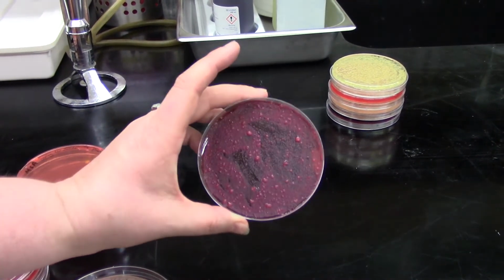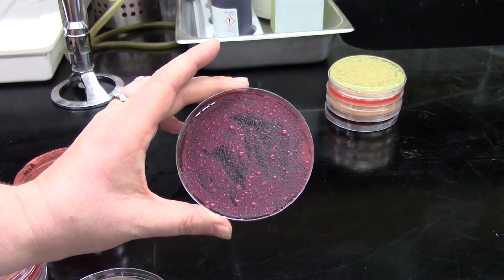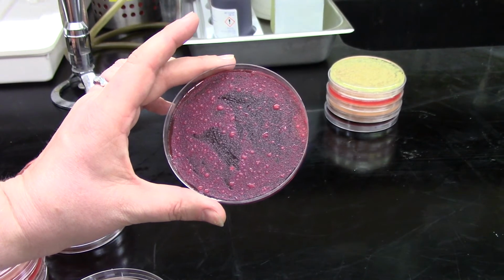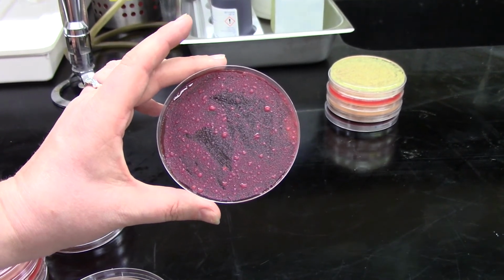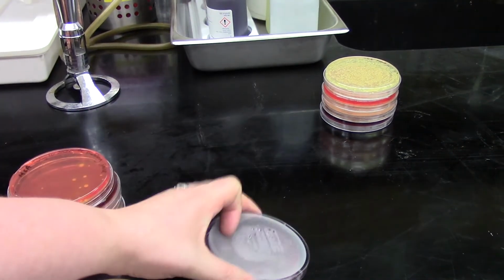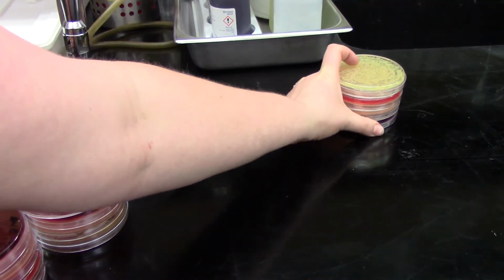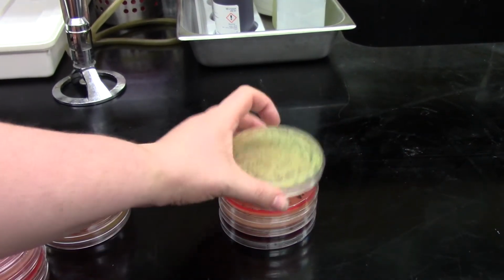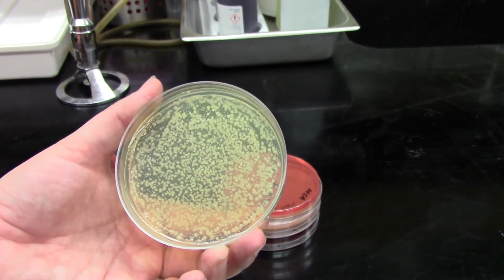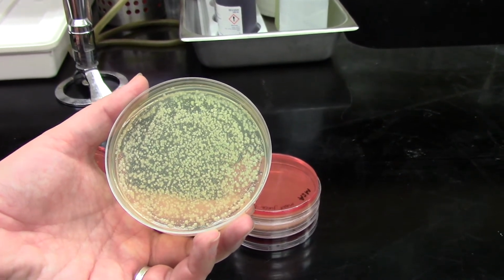And then here our bacterial colonies are super closely packed together. It's basically a lawn of growth, but again, I can see that we've got at least 3 different colony morphologies, and some of those are really mucoid. None of them have that metallic green sheen though. So that's why we need to now look at the ones that were diluted a little bit further. On TSA, again, we've got growth throughout the entire plate, but here I can start to see that we've got at least 3 distinct colony morphologies.